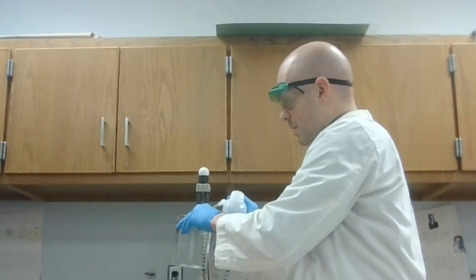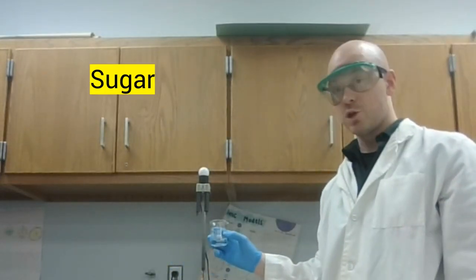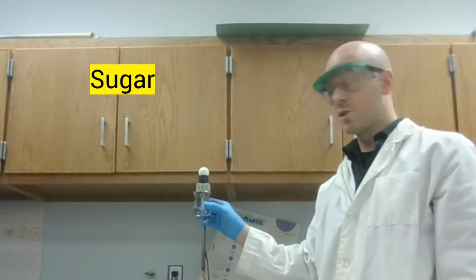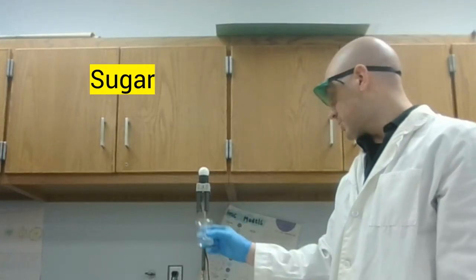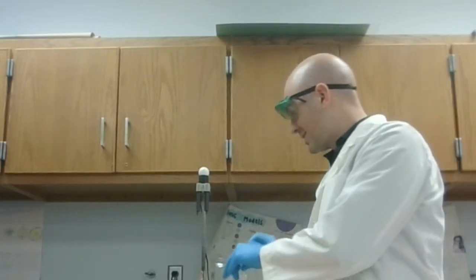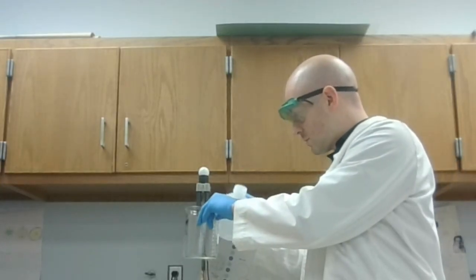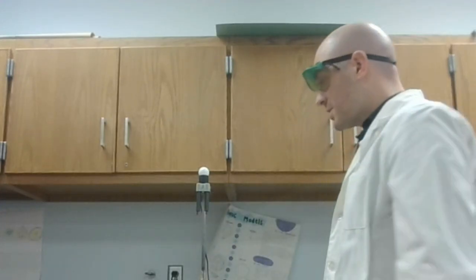And now our next sample is going to be sugar. Let's see if sugar is conductive. So sugar is also not conductive, not at all. Sugar does not conduct electricity when dissolved in water. So far, not the most interesting test. So that's 3 out of 6 samples not doing anything with conductivity.